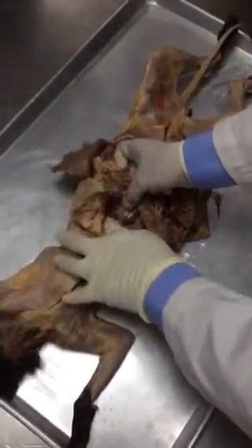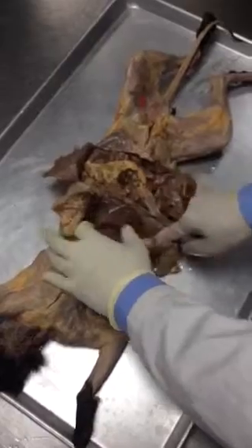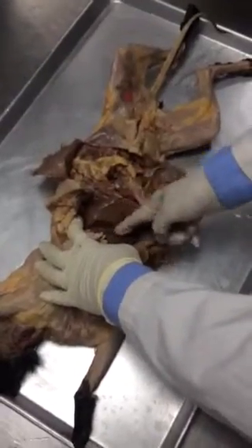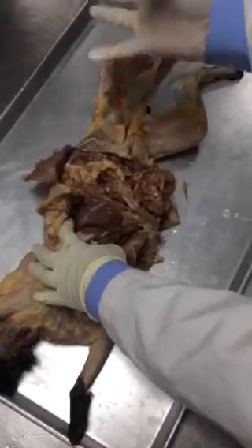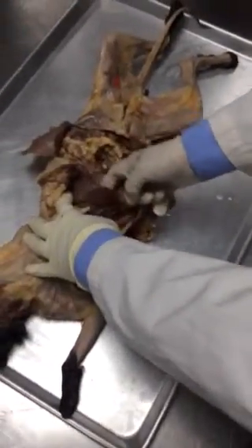And you see the lesser curvature, and here is the lesser omentum. It is connected to the liver. Here is the liver, right? In case of human beings, liver is the largest organ as well. But in case of cats, you see the liver has got lobes. In our body, we have got 4 lobes in the liver, but all the lobes are interconnected. So we see the single piece. But here you see 1, 2, 3, 4 lobes still separated.